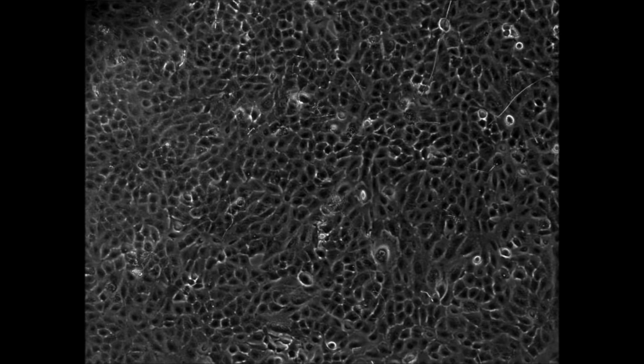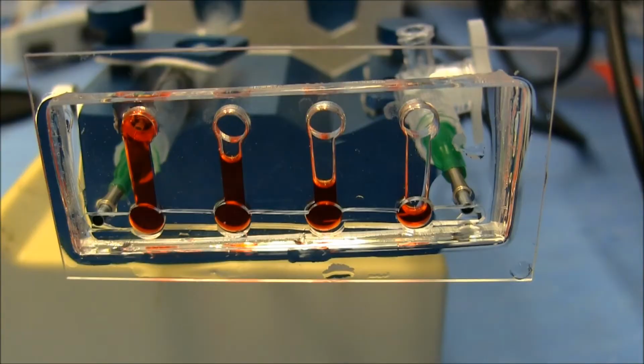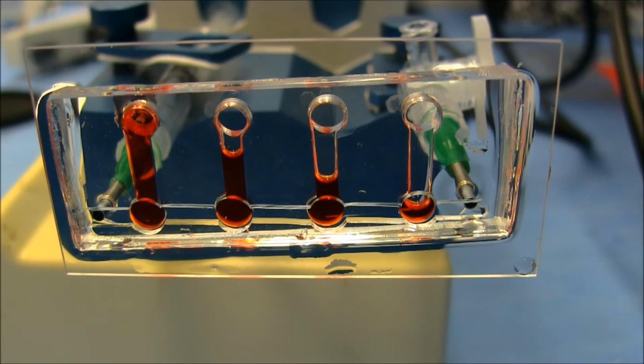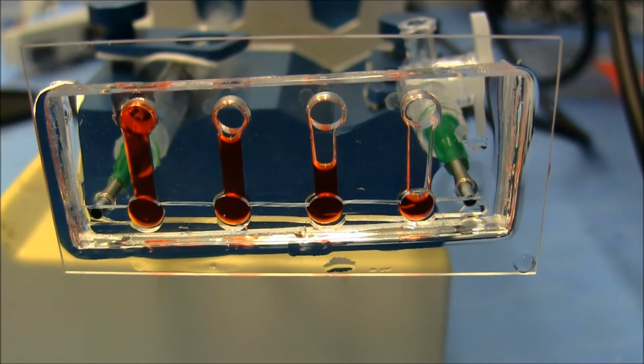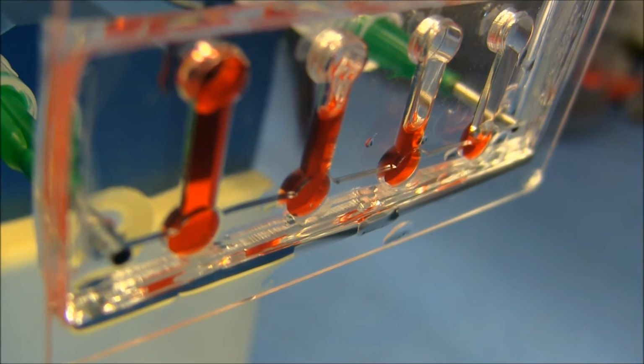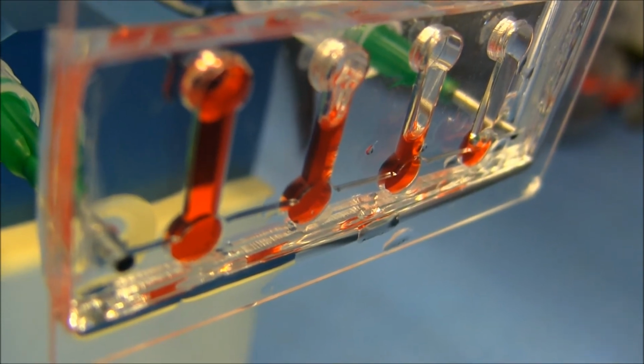We make the entire device hydrophilic, then insert the cells at a predetermined density and let them sit for 2 days until they form a nice monolayer on the membrane. Here you can see the membrane stretching. The stretch provides the mechanical force. When we add fluid to the device, the stretching of the membrane allows a meniscus to wash over the cells, applying the fluidic force.